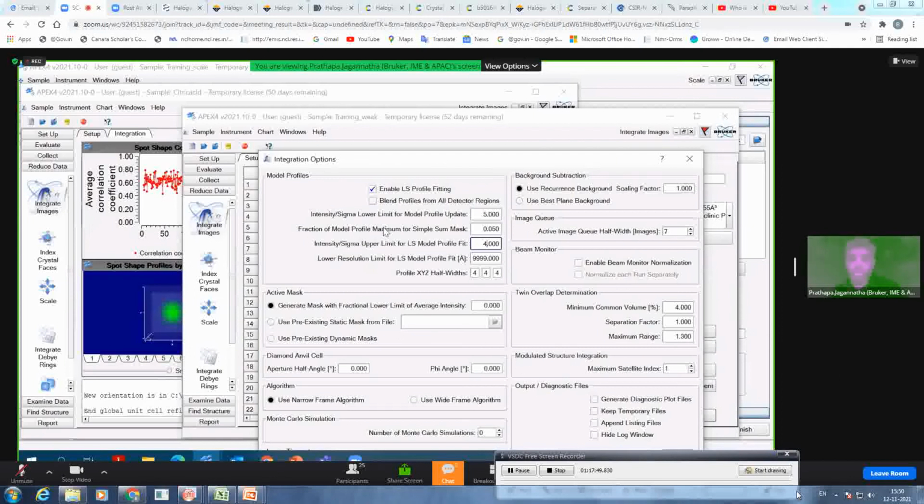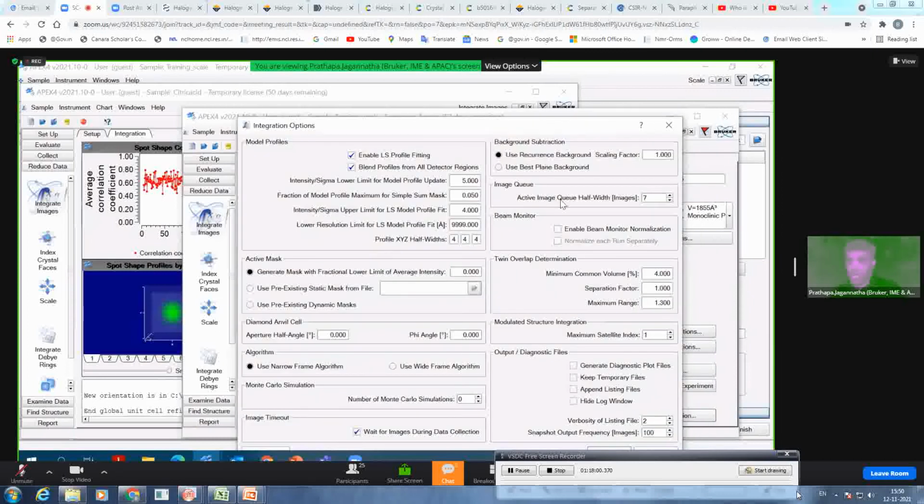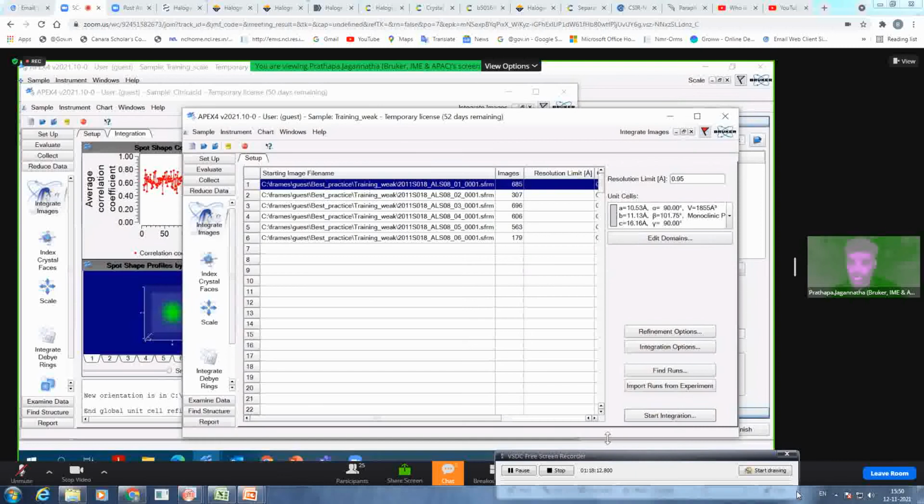Along with that, I also know that not all the detector regions have a strong reflection. So I want to blend those reflections from all detector regions. But reflections are not strong enough, so I don't need to modify the frame queue. So I keep it as it is. And this is molybdenum data, and I do not see too much background difference. So I keep it as the default background. And then I say okay, and then I just start integration. So let's see whether there is any improvement.